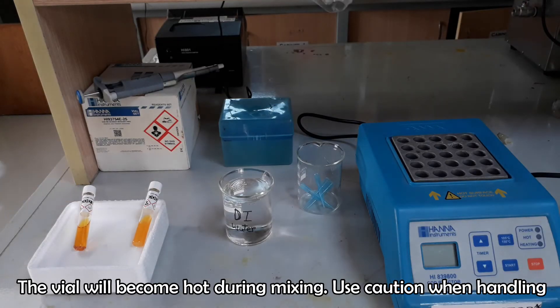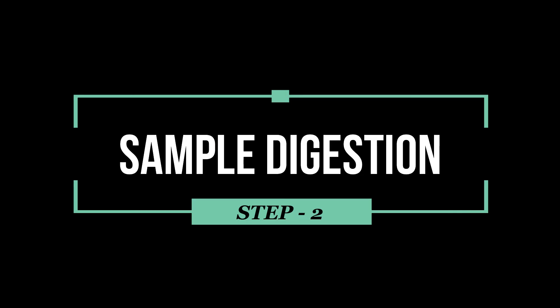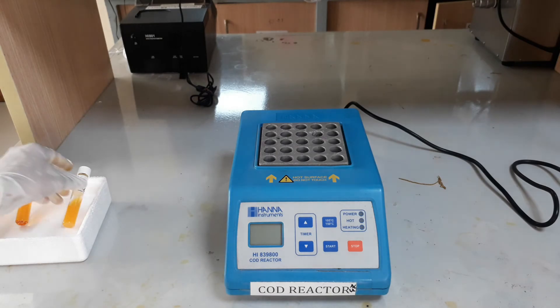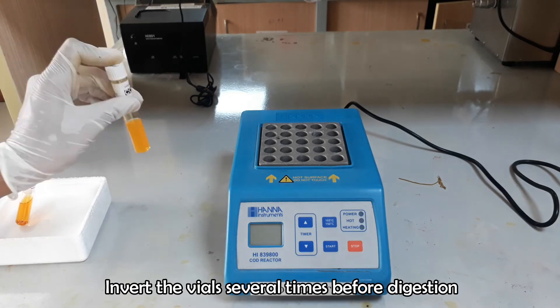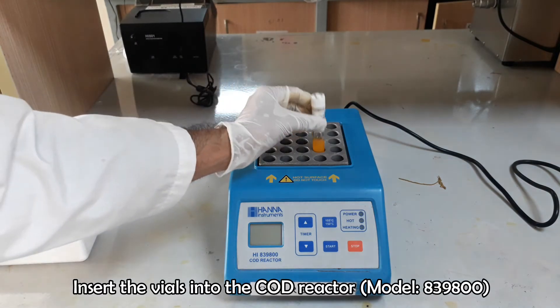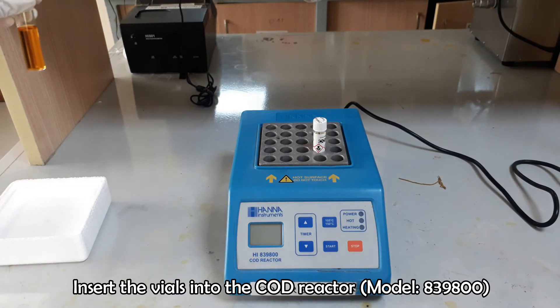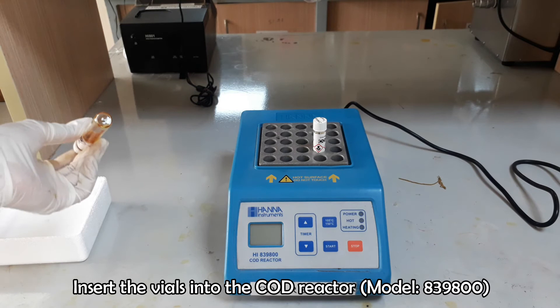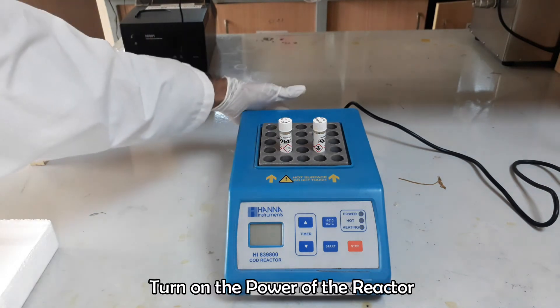The sample and blank are ready to digest. Place the sample and blank in the COD reactor and turn on the power of the reactor.